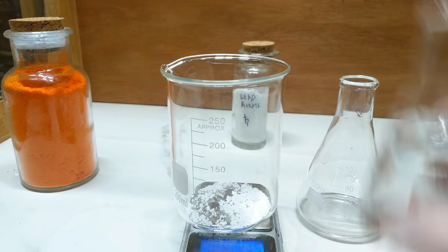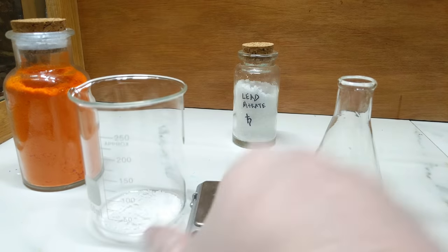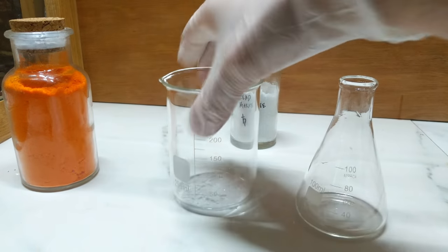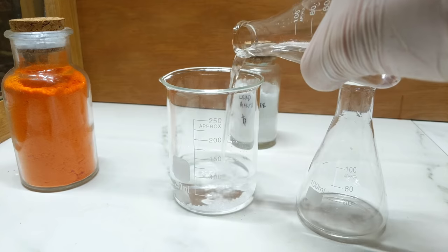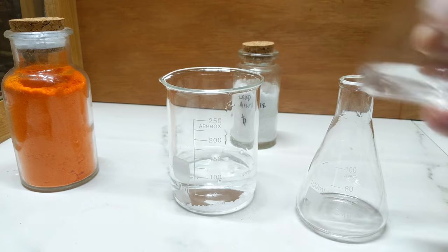To that I will be adding approximately 100 mils of water in order to dilute the solution.